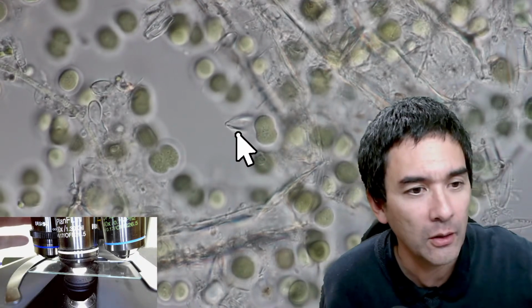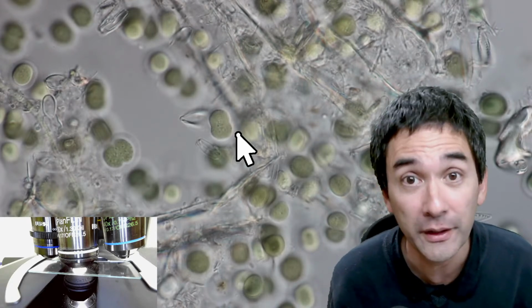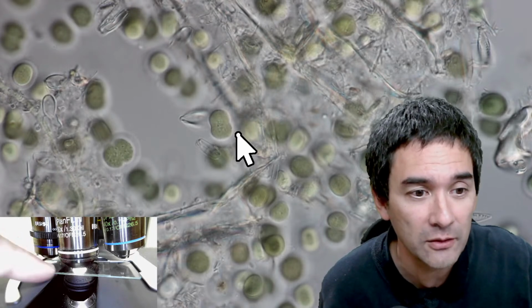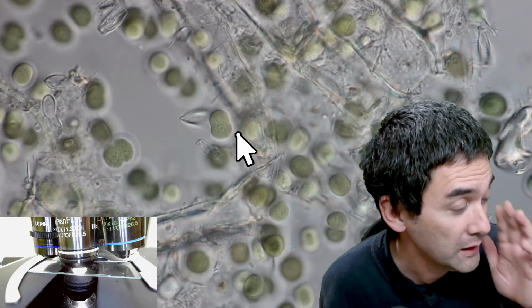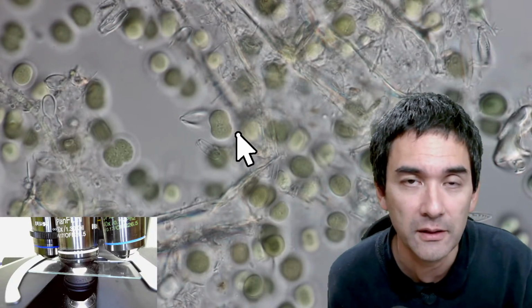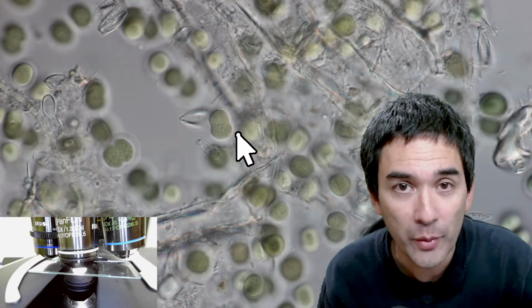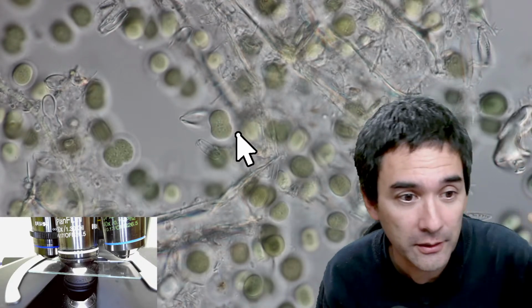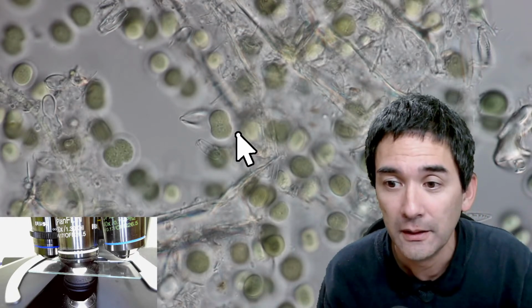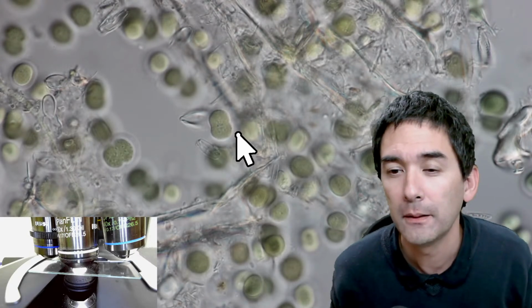But now what? If I go back now using the 60 times, I'm afraid of doing that, because I might indeed dip the 60 times objective into the immersion oil. I don't want to do that. So this is something where you have to be a little bit careful, because instinctively, like in my case, I like to switch magnifications quite often, and then you don't think, oh my gosh, I'm actually using oil immersion the whole time. You forget about that, and then you rotate it, and then it gets contaminated.